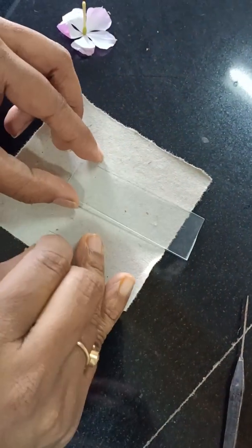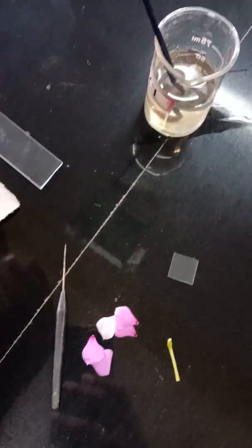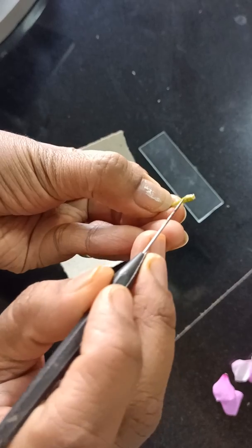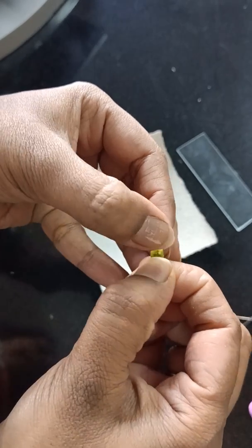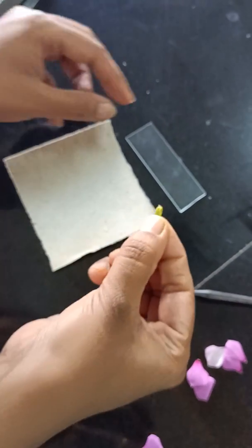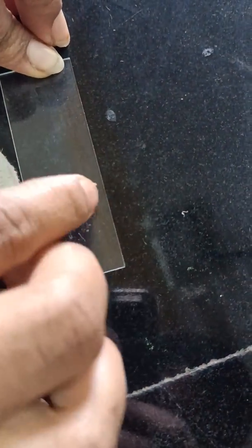You can notice the pollen dusted on the slide — that is one method. There is one more method using a needle: remove all the petals, then use the needle to trace the area where the anthers are situated. Once you cut it open, you could see the sagittate, arrow-shaped anthers. You can then smash these over the slide, and you can see the deposition of pollen grains.